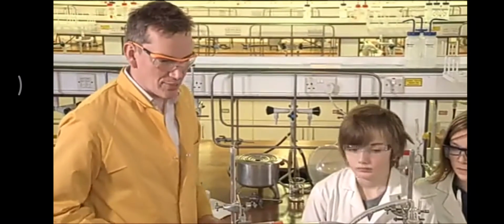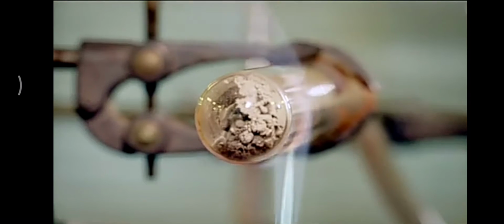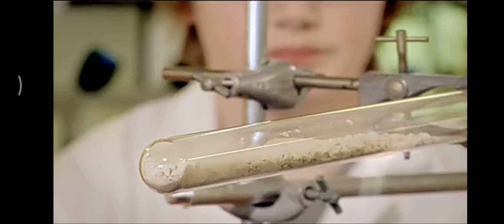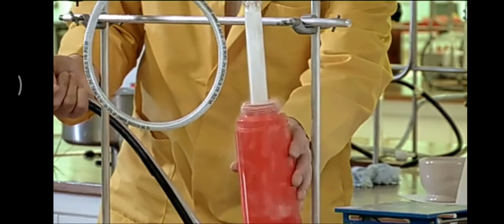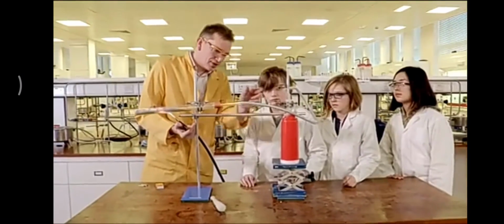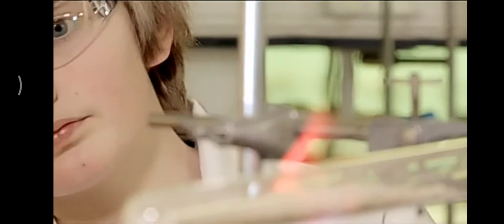Now, we need pretty high temperatures for this, so I'm going to use 1,000 degrees C, this particular flame. So the calcium carbonate contains, well, which elements do you think it's got in it, calcium carbonate? Calcium. Calcium, yes, clearly. The carbon is in the name. Carbon, yes. And there's one other one. Oxygen. Oxygen, that's right. Now, I wonder if we're getting anything forming on this side. Well, we've got some white on the sides there. That could be some carbon dioxide. I think we'll stop heating this in a moment, and I'm going to attach a balloon to here in a minute, and then maybe when we remove this, as the CO2 turns back into the gas, it might blow up the balloon. We'll see.